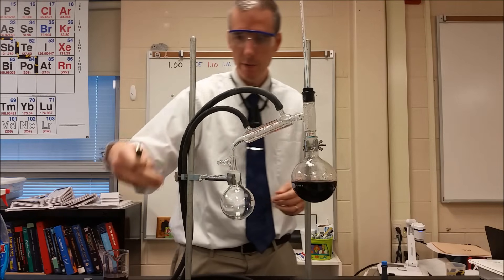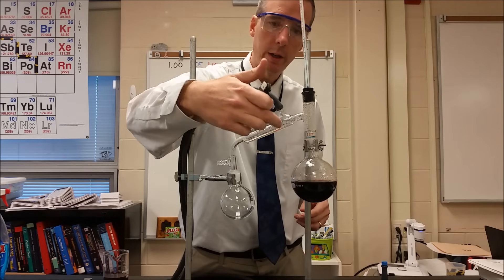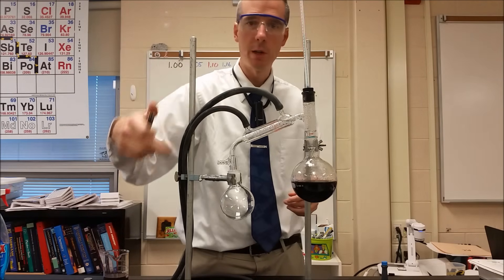And then over here we have some tubing coming out of a sink that feeds in right here, and that brings cool water along here, and then it comes out through this tubing and back down the drain.